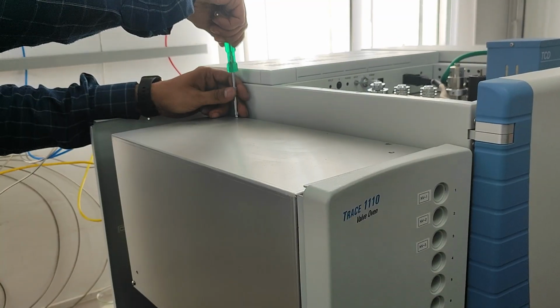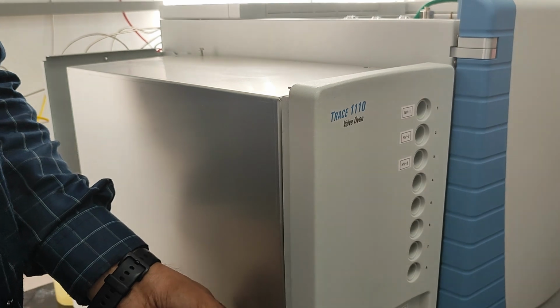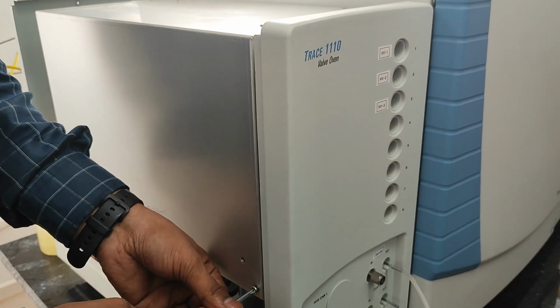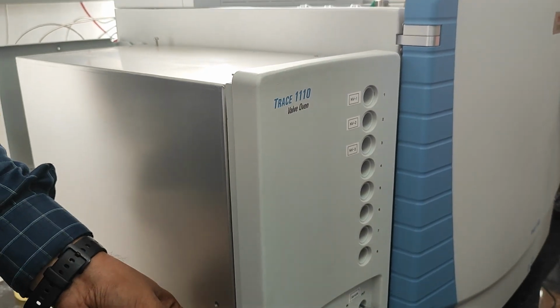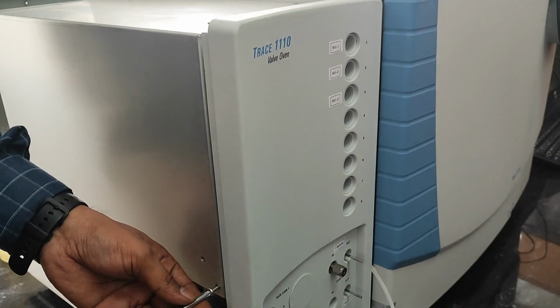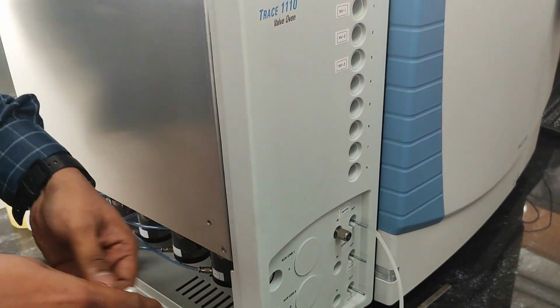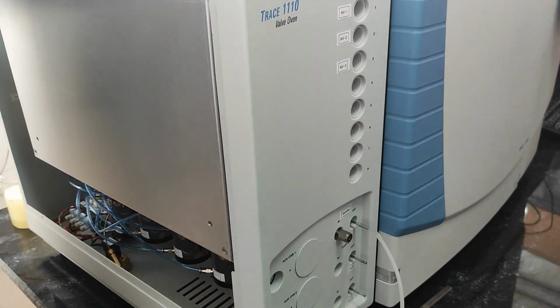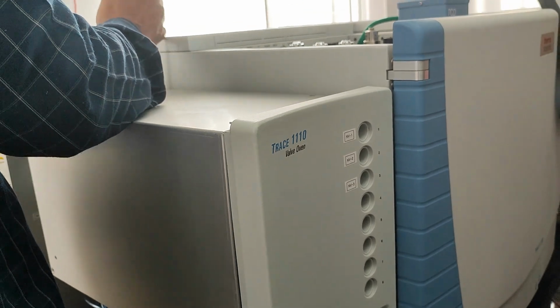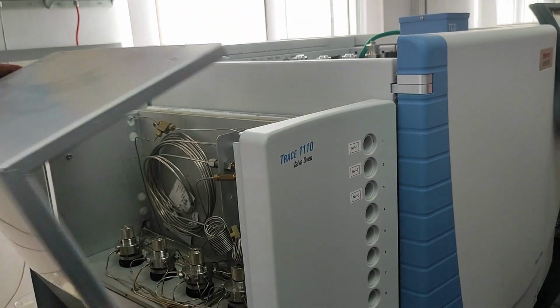It is very less. Actuated with the air. Yes. What is inside the methanizer? Nickel catalyst. What are the preconditions for the methanizer to work? There should be hydrogen flow and the temperature should be above 350. Then only it can convert. Without temperature, the reaction will not happen.